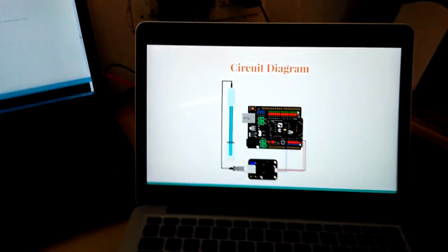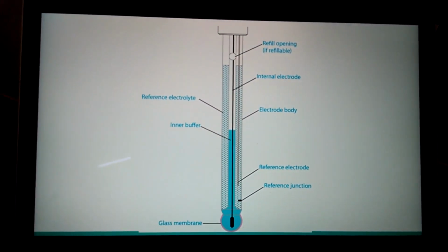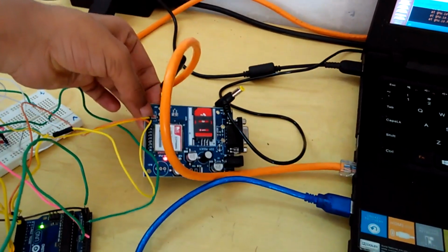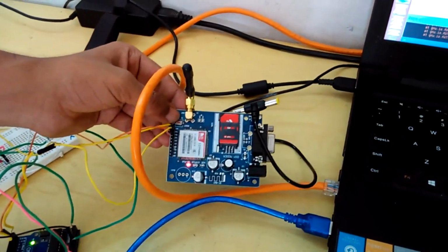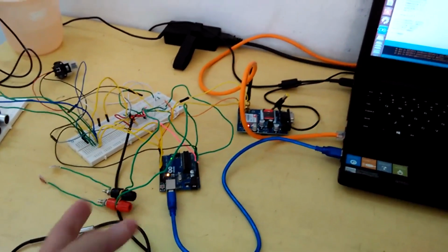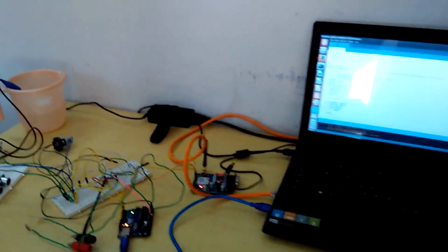This is the circuit diagram. It's not very complicated. This is the structure which I was talking about. And finally, we have used a GSM module, SIM 900A. It is basically like a simple mobile phone which is able to send and receive calls and SMS. And we have used an actual SIM card, so it's able to connect to the GSM network. For the data which we collect, we establish a connection using code between the Arduino and the GSM, and the GSM does the rest of the job of transmitting it onward.